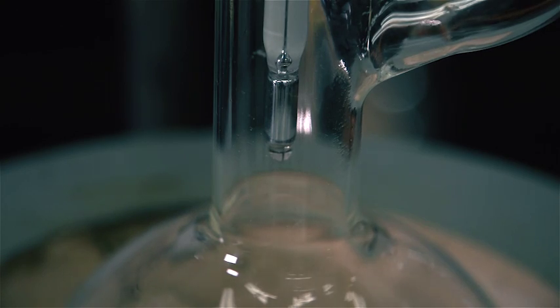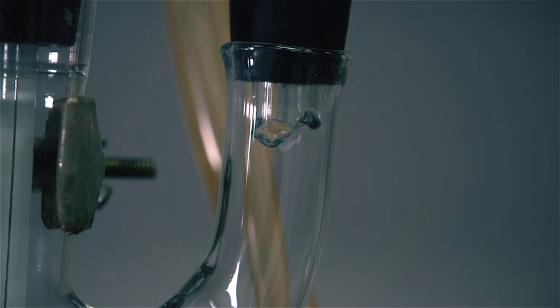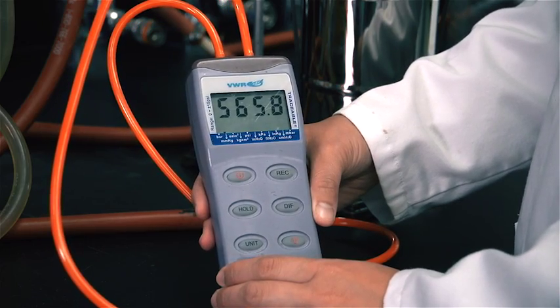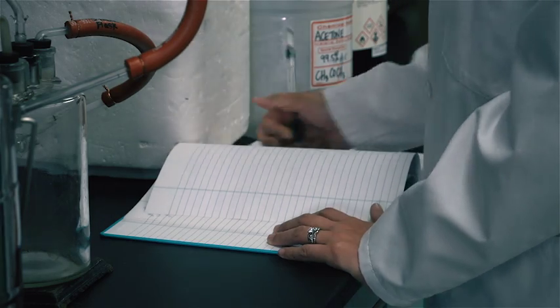Observe the boiling point. The liquid is boiling when it is bubbling in the flask and it drips off the condenser and the thermometer. Simultaneously note the boiling temperature and the manometer reading and record them in your logbook.